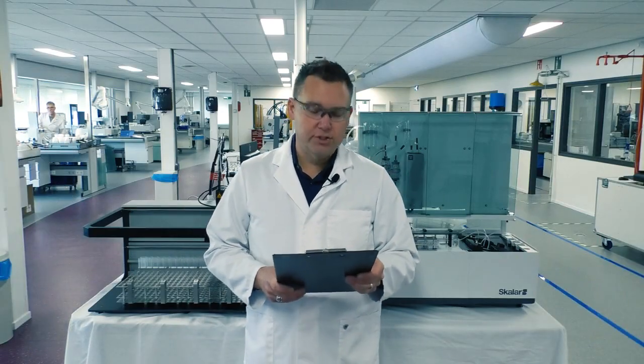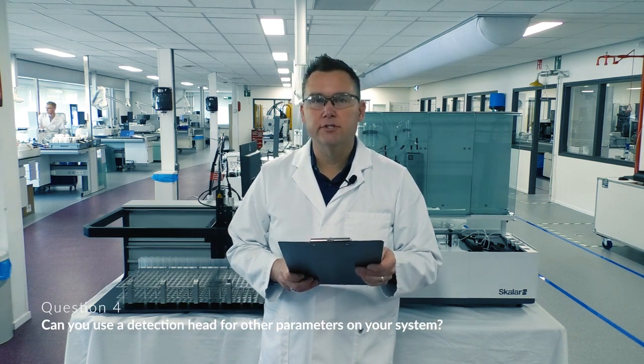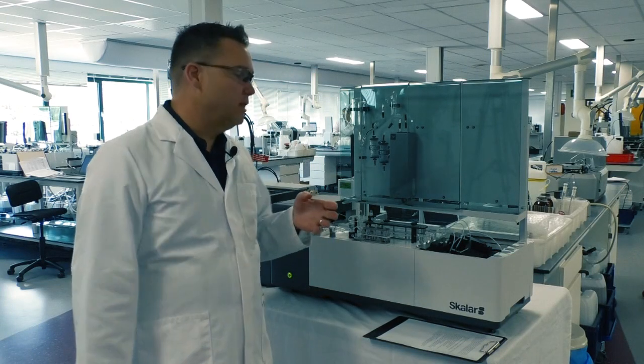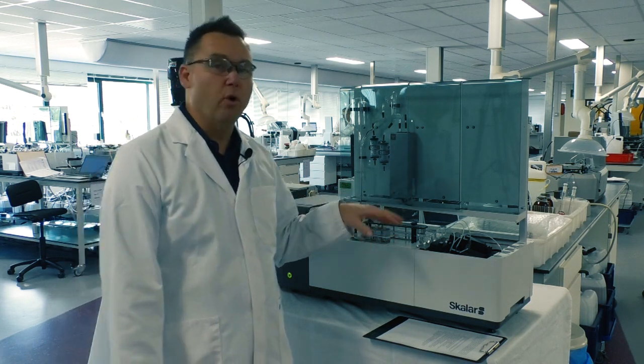And now our fourth question. Can you use a detection head for other parameters on your system? Well, that answer is easy. So yes, we can use these detectors. They're not designed for one particular chemistry or wavelength.